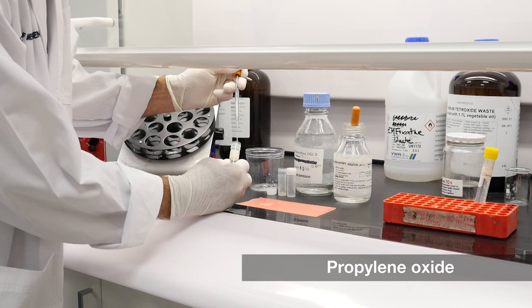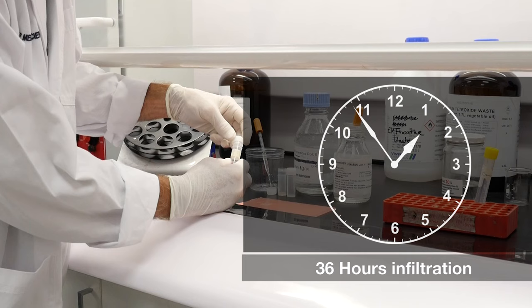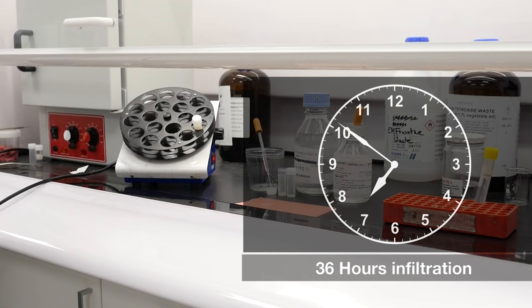Specimens are infiltrated initially with resin diluted with propylene oxide, and eventually with 100% fresh resin. After approximately 36 hours of resin infiltration, the tissue is ready for embedding.